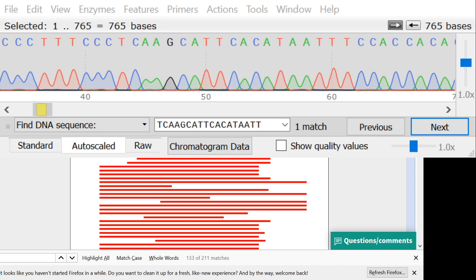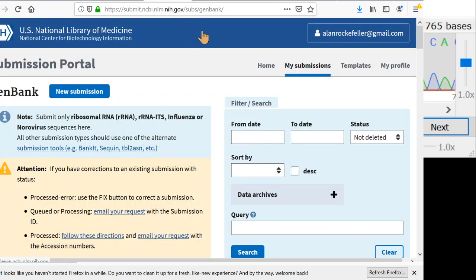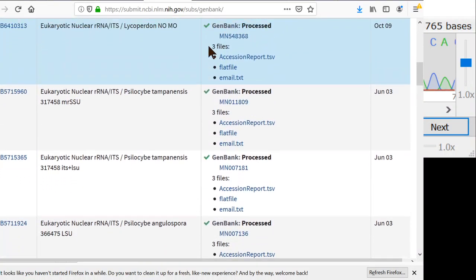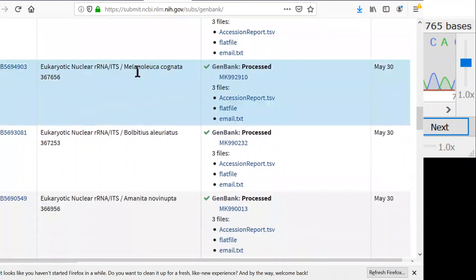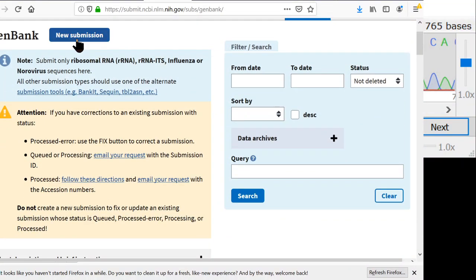So we'll close that, go back here, and put Firefox back on top. Here's the GenBank submission portal. There's a bunch of different ways to submit stuff to GenBank, but the easiest way is through this submission portal. I just logged in here. Anybody can create an account on here. I just signed in with my Google account to make it easy. Now if I scroll down, I can see the submissions that I've submitted before. Here's the last one I did, a Lycoperdon, and all the stuff that I've submitted to GenBank is there. So to make a new submission, I'll hit new.